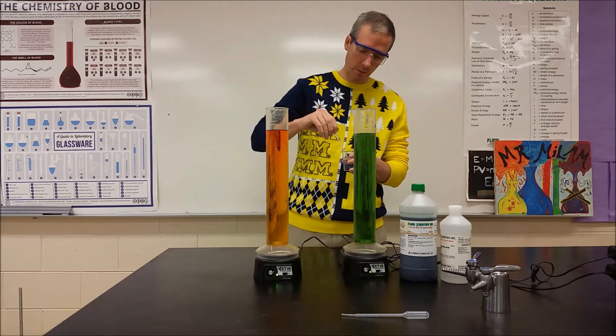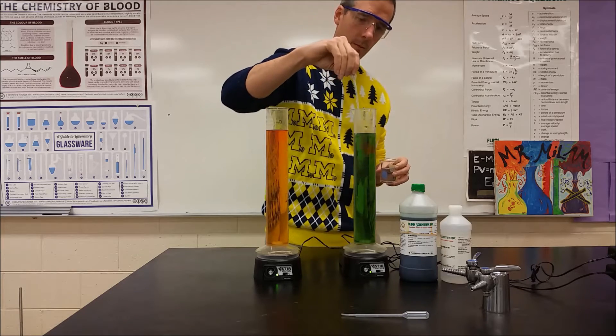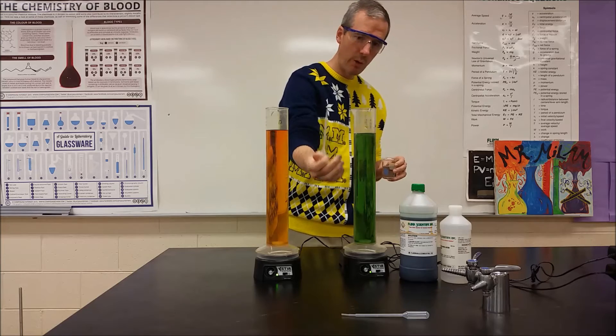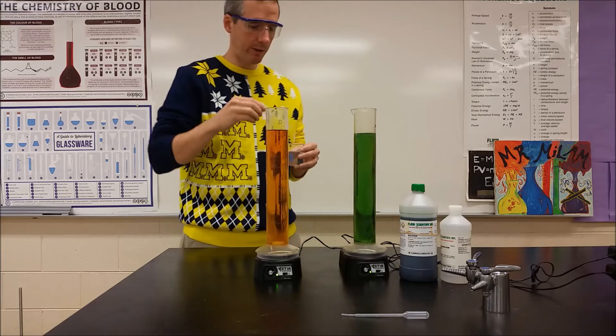We're going to add another milliliter to each. So again, we see a quick glance of red and it quickly fades away and we're still kind of at the same green color.